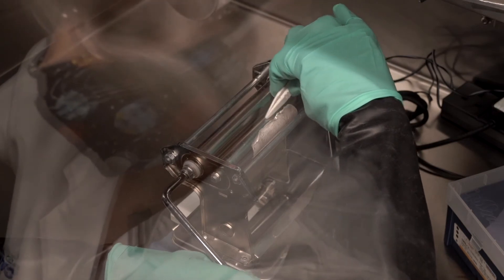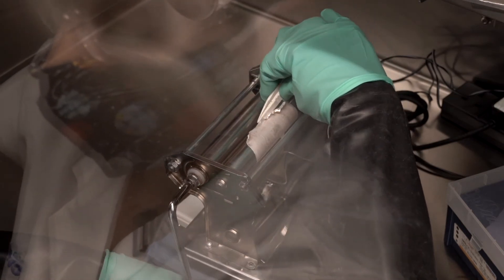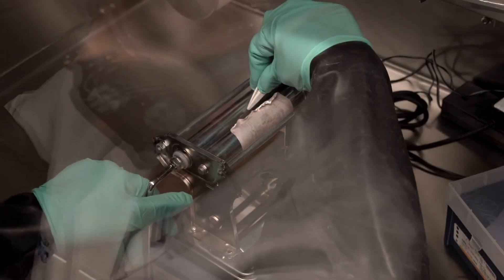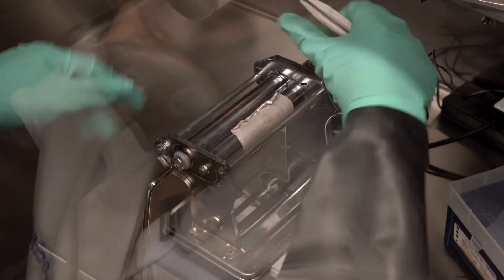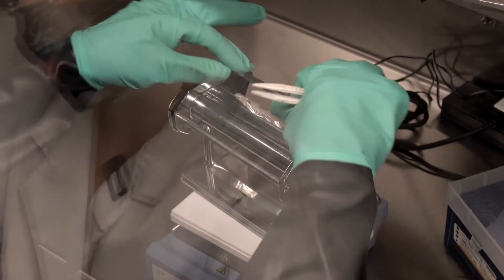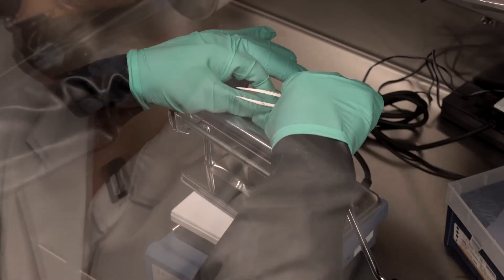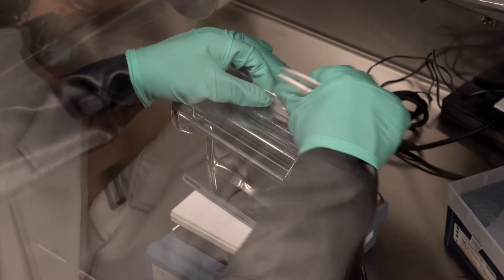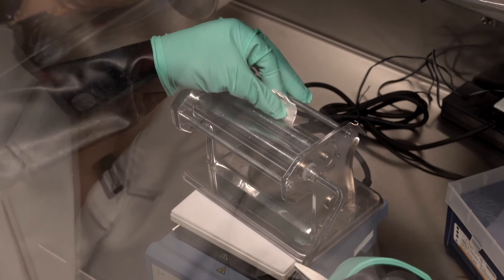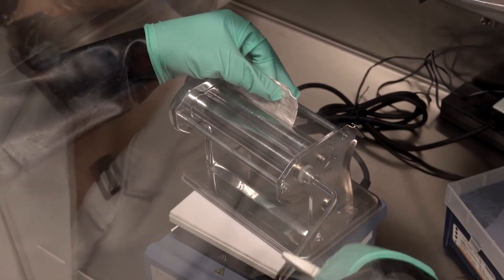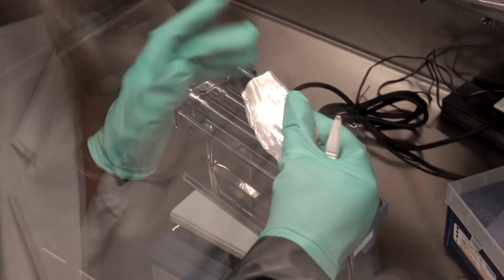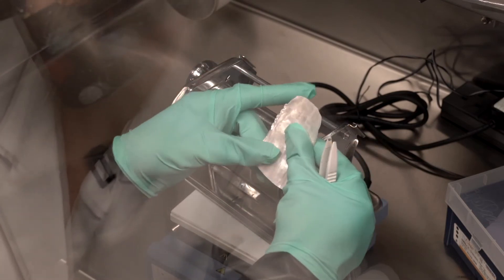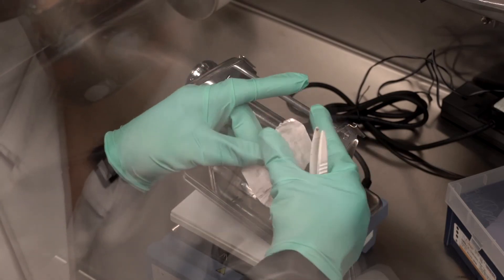Now if a piece tears, it's not the end of the world. You could reconnect it, but the seam will not connect very well. So I tend to keep those torn bits aside and use them as reference electrodes in my cell. All right, so that's as thin as I'm going to get it for practical purposes.